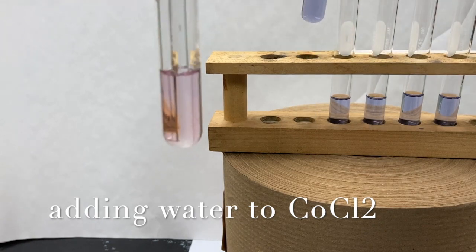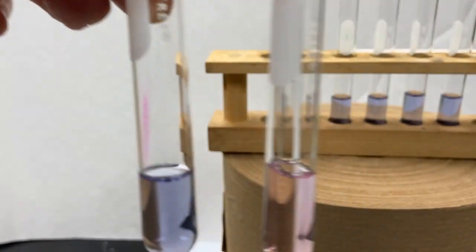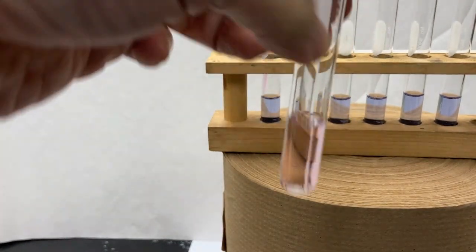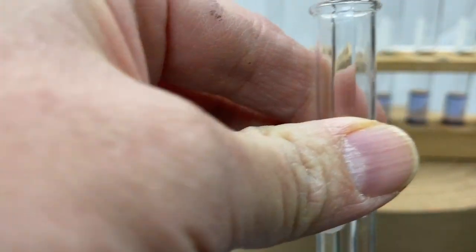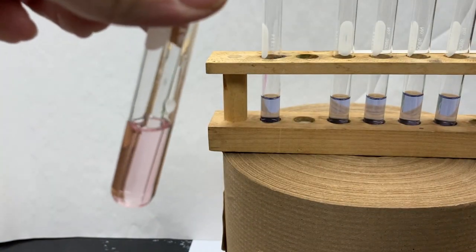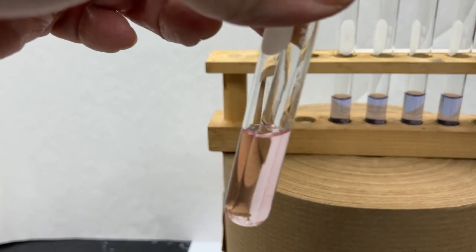So if we compare it, oops, actually I did that to the wrong tube. So we'll use this as our new tube 1. By adding water, the solution is no longer violet. Let's go ahead and add another drop. Another drop.